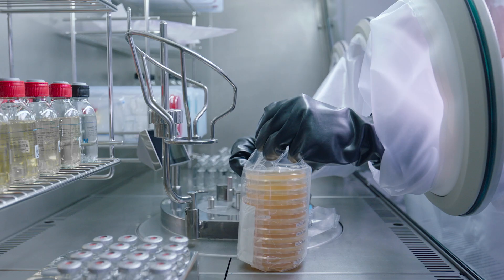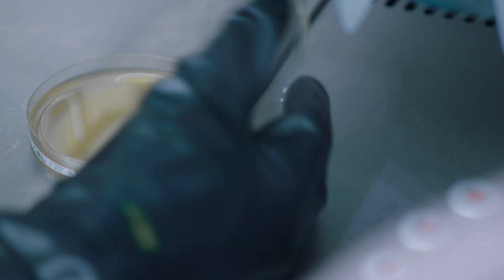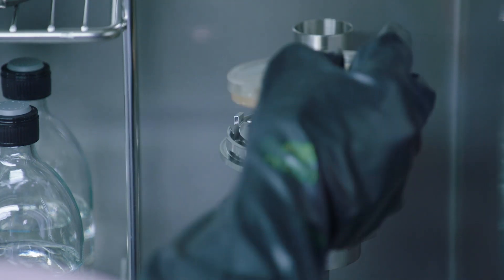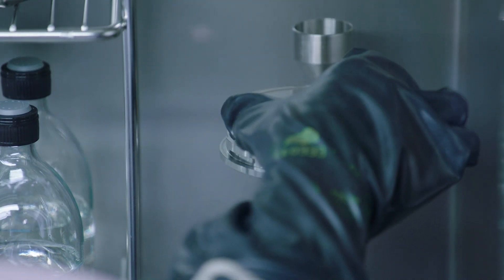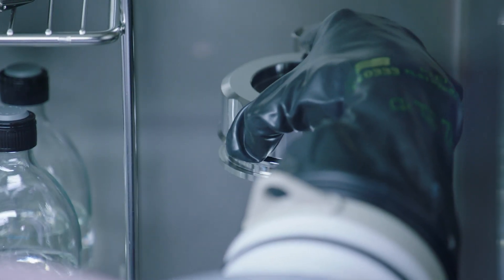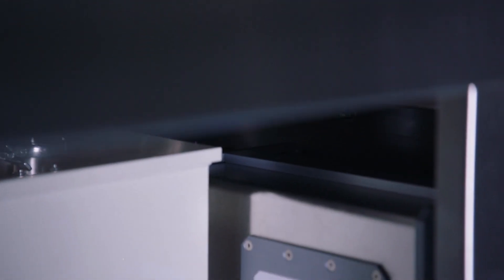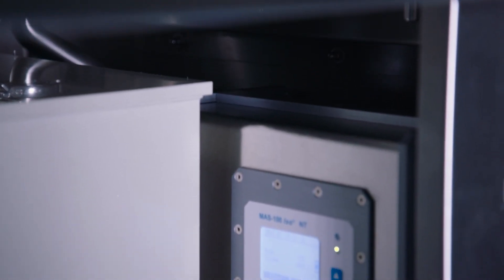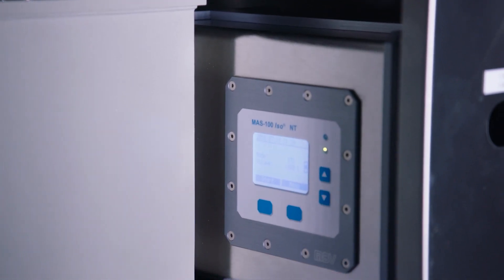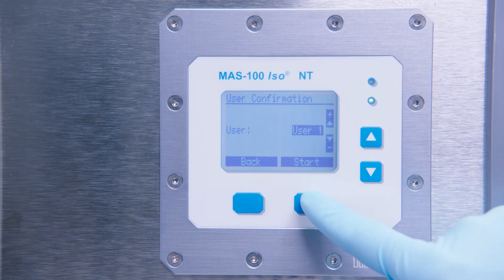A Millipore Sigma ICR settle plate for environmental monitoring is placed onto the working table. Isolators must also be monitored with an active air sampler for possible air contamination. After starting the MAS-100 ISO-NT, the system collects 100 liters of air per minute for a defined and validated time. Usually, one cubic meter is impacted on the media.